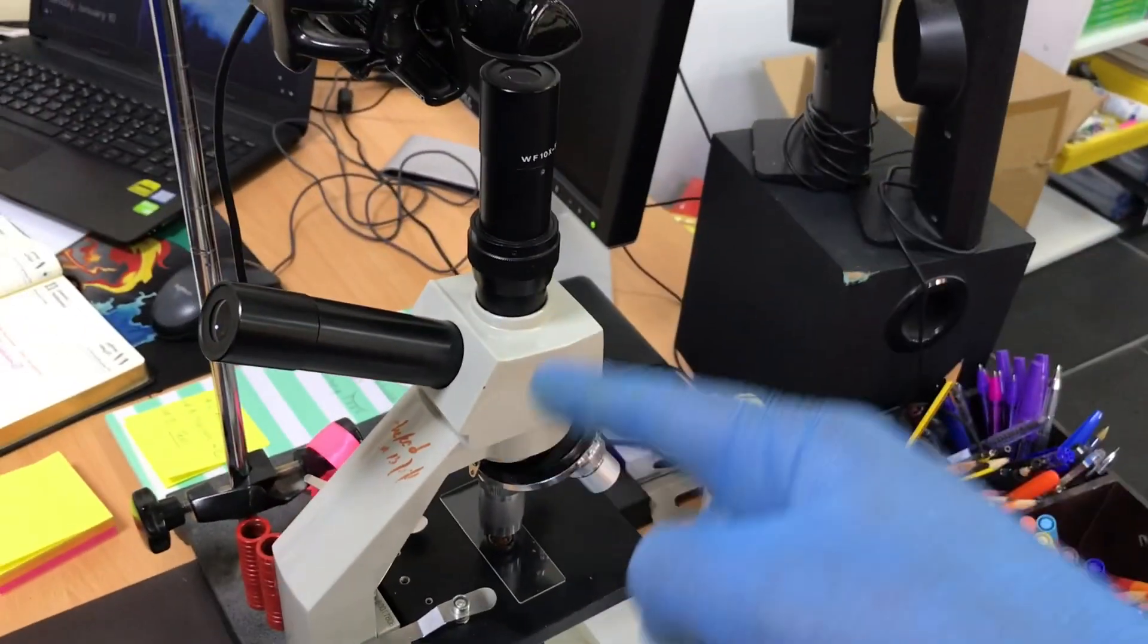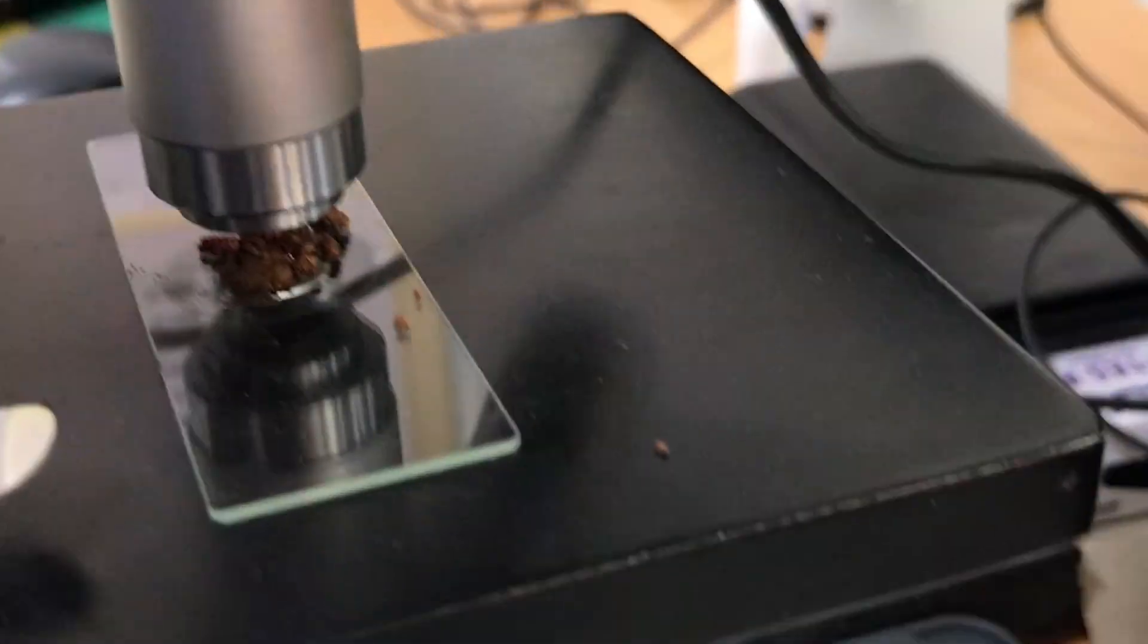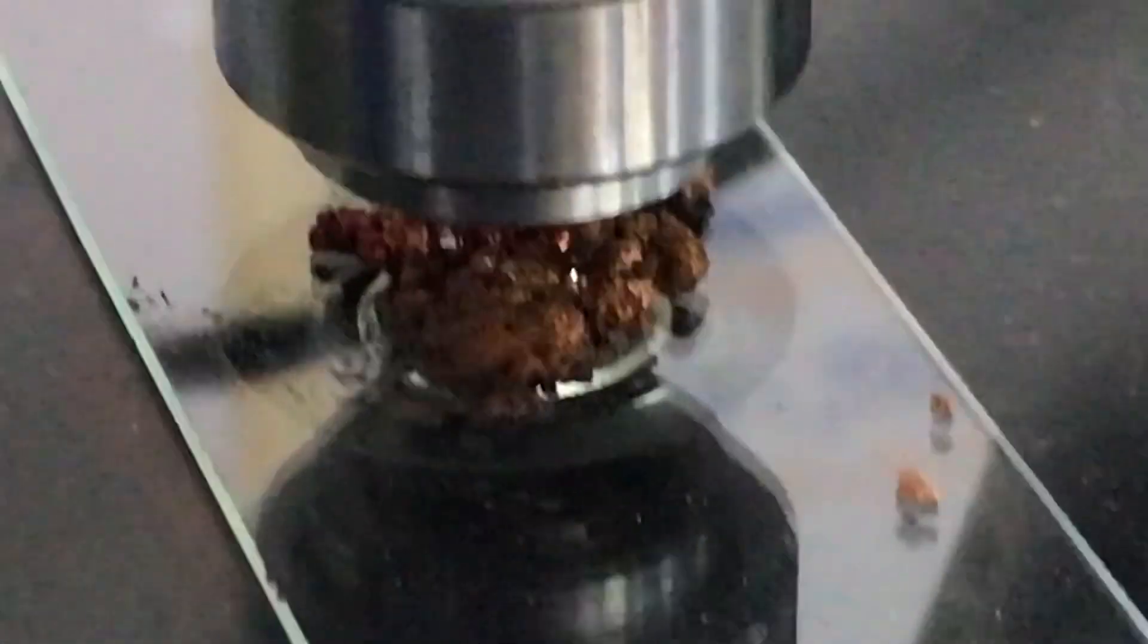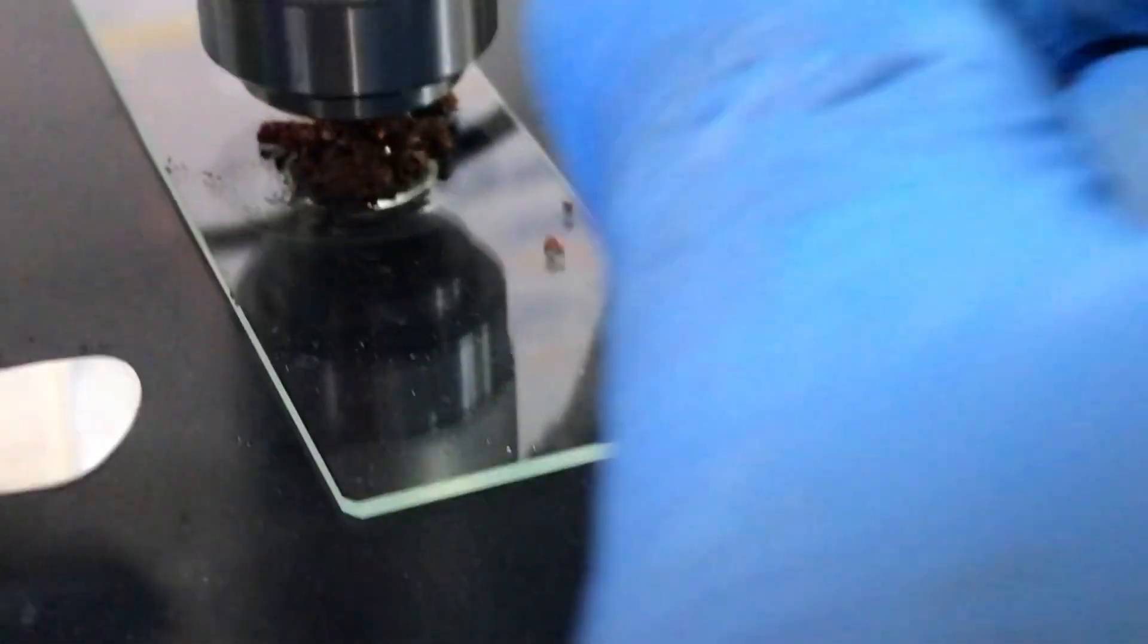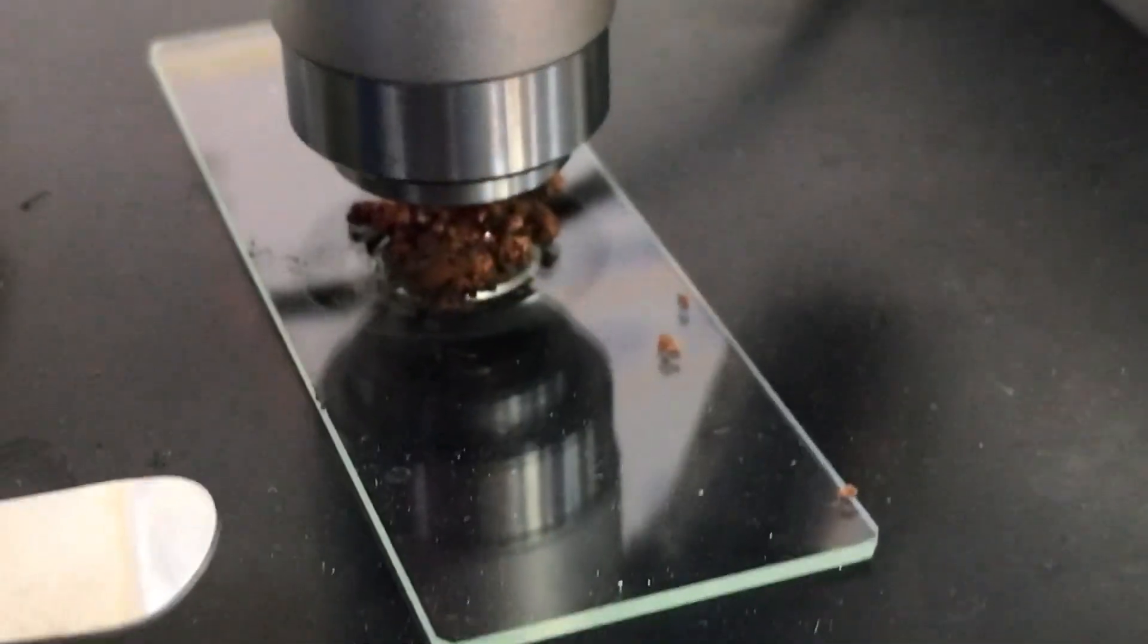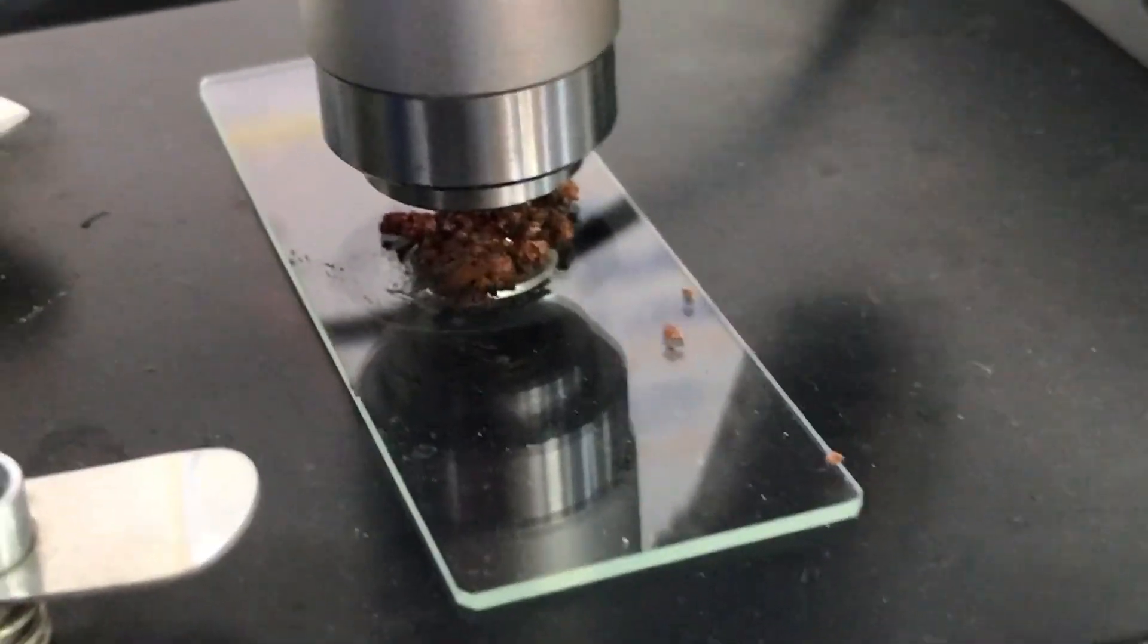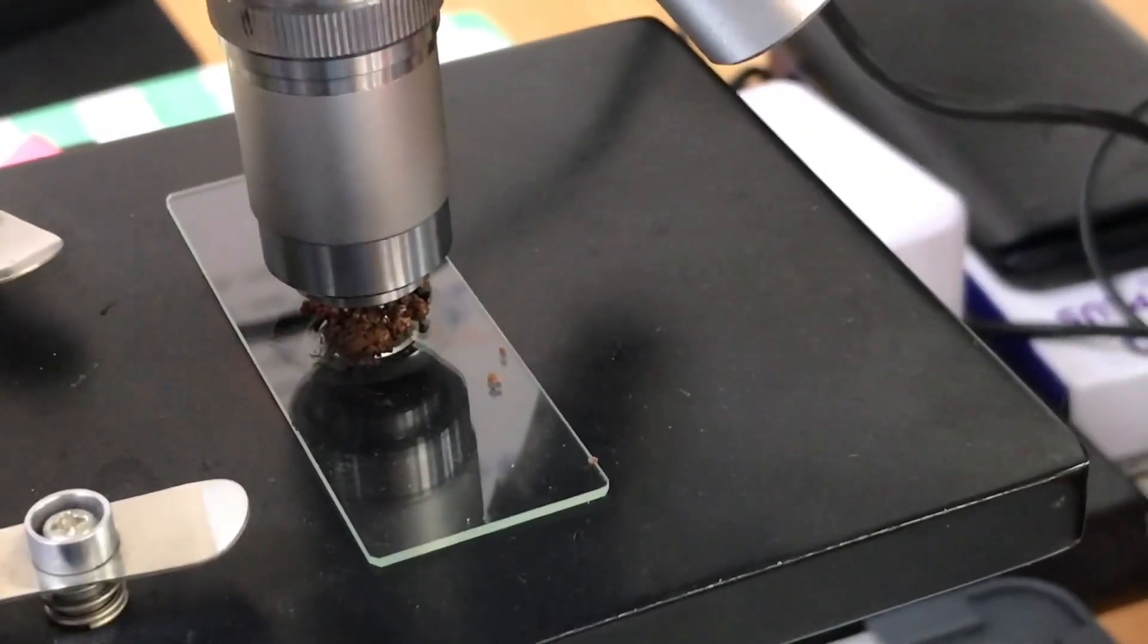So what I've been able to do is set up a microscope. I've set it up on a webcam that I've arranged before and I now have my microscopic slide containing my copper. Now there's various ways in which you can actually do this. A popular method that I choose to take quite often is that I use a phone light to allow it to reflect off the copper surface. I'm not going to be able to do that unfortunately right now because I'm filming at the same time, so I'm just going to have to rely on the natural light of the lab and also the light of the microscope. Now if you can't see anything if it goes black then all you'll need to do is just turn this light off and let's see what we've got on the display.